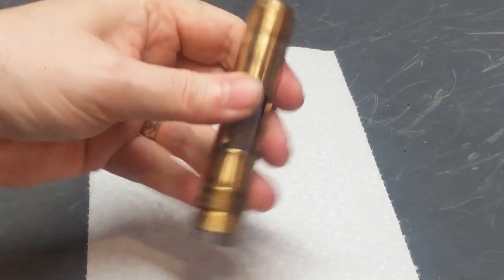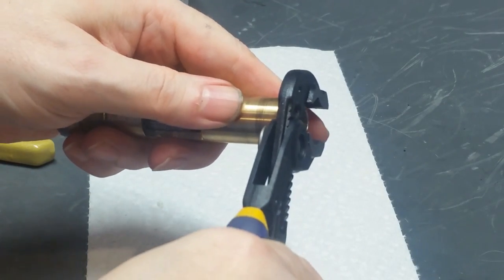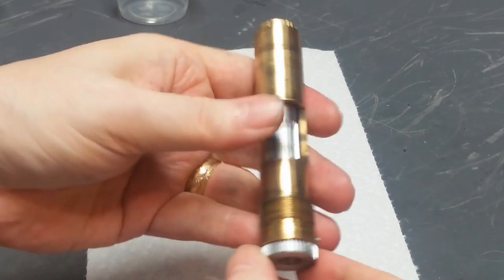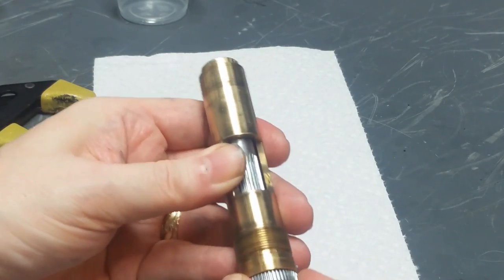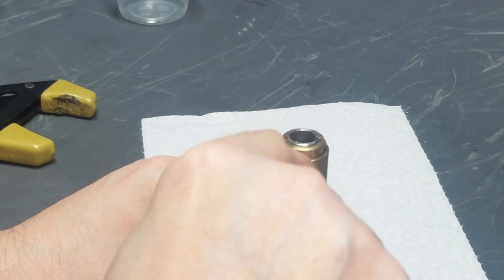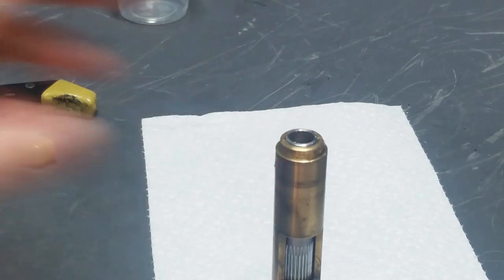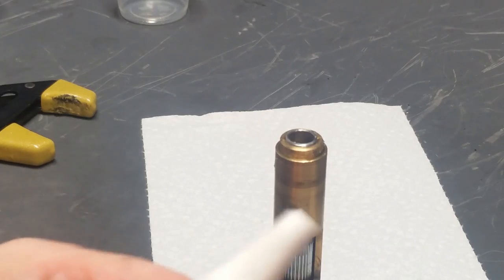Off just a little bit, and it feels just about perfect. I'm going to go just a little bit more. Okay, now that feels very smooth, like it should feel. No axial play. That's basically the right position for it. And the reason I didn't want to get any grease on these threads when I was reassembling them is because the next step is to place some Loctite.